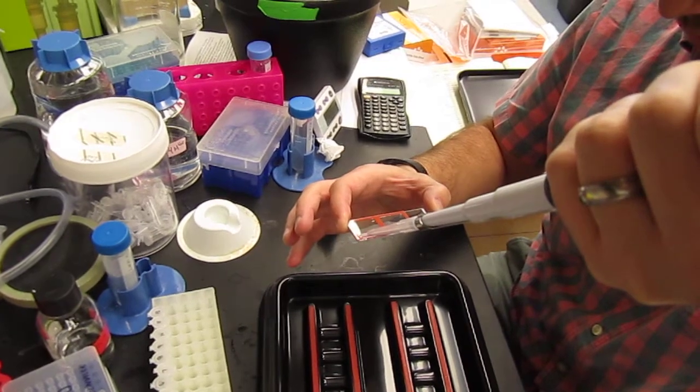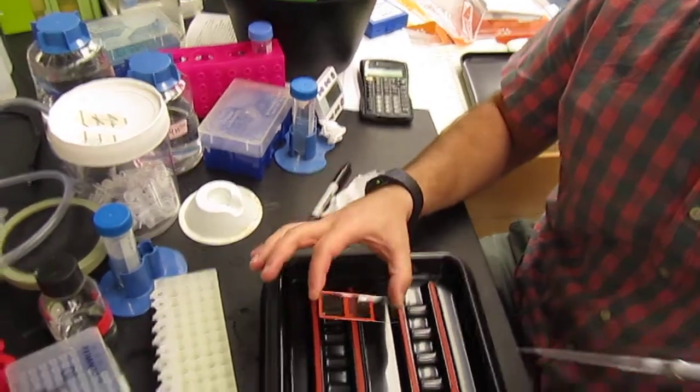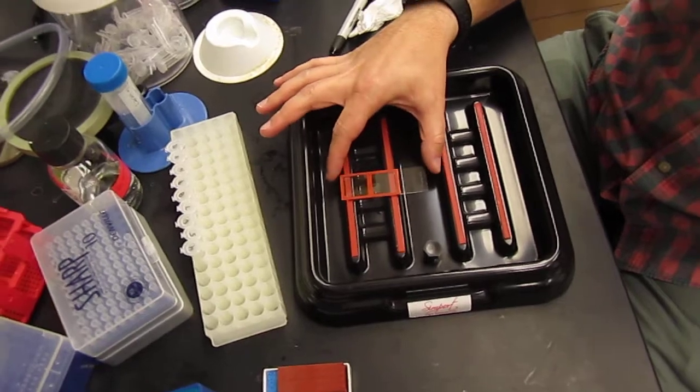And finally approaching the bottom. Like so. It has to introduce no air bubbling.